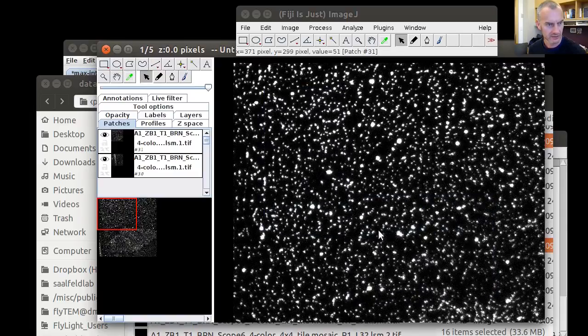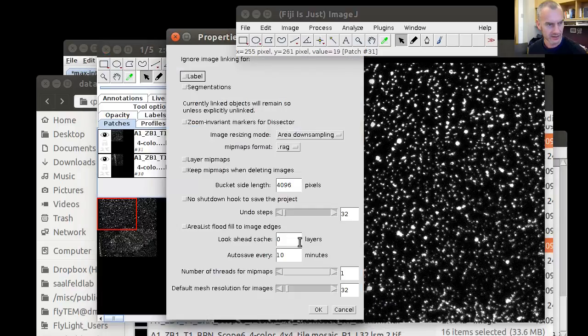In order to render lens corrected images, we want to have that at the best possible, or at a pretty good precision, and we want it fast, so we increase the mesh size that is used to tessellate the images for rendering, and the number of threads that are running in parallel to generate preview images.